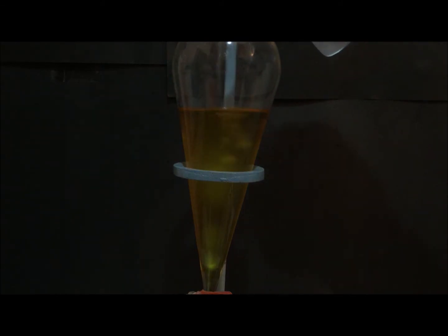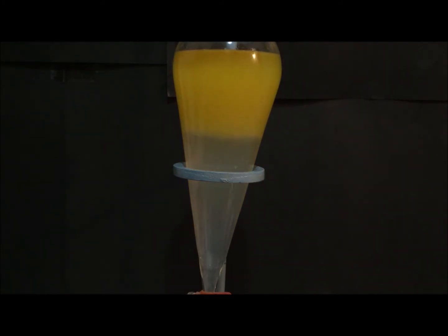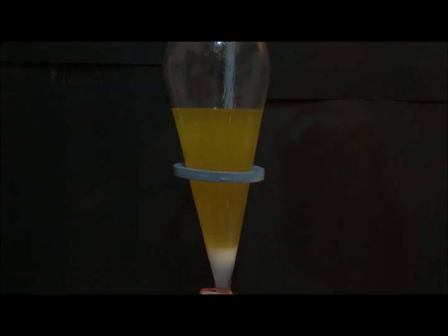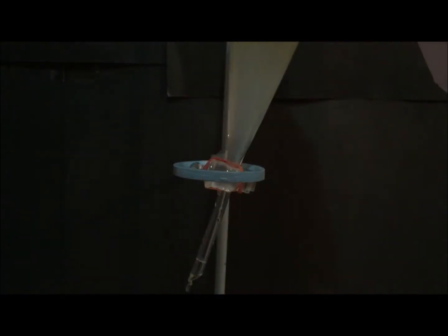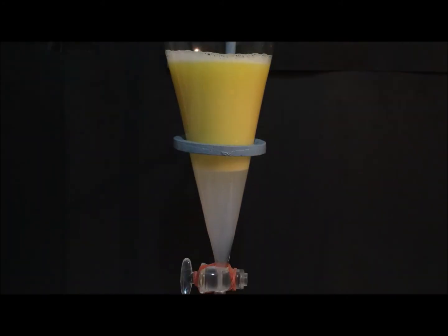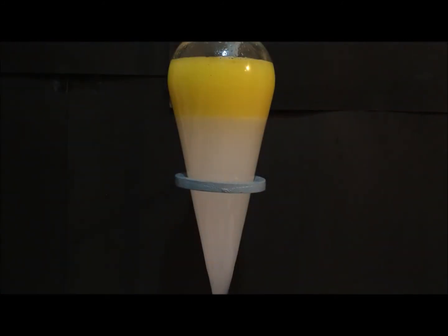Biodiesel is washed with distilled water several times. First, 250 milliliters of water is added and the funnel is capped, gently shaken and vented, and the water layer is extracted. For the second time, again 250 ml of water is added and the funnel is shaken vigorously to form an emulsion, which then again is allowed to separate. The water layer is then extracted. For a third time, concentrated salt solution at 50 degrees Celsius is added to extract as much water as possible from the emulsion, and the lower layer is discarded again.